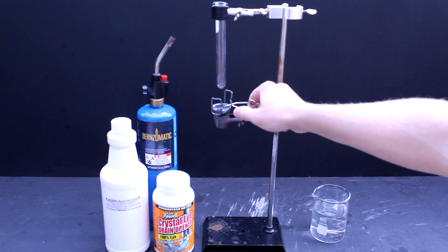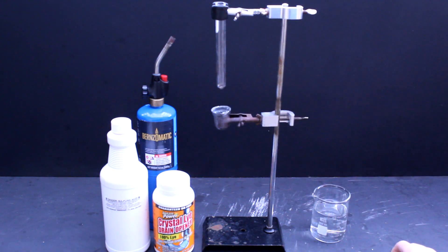We'll also need a steel or iron reaction vessel of some kind and a strong heat source. I opted for my blowtorch.